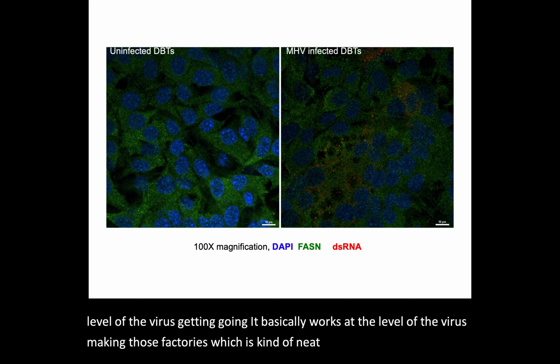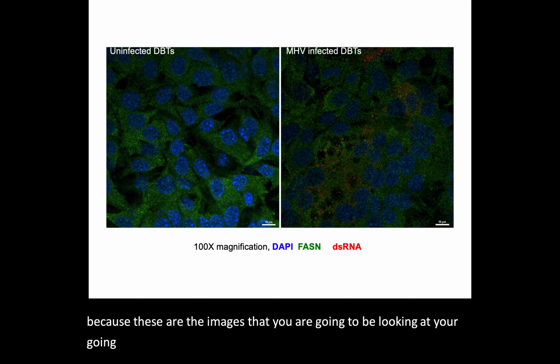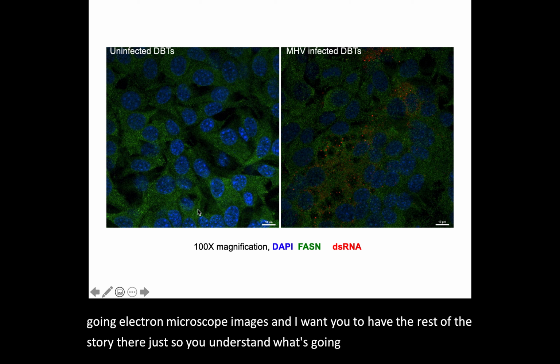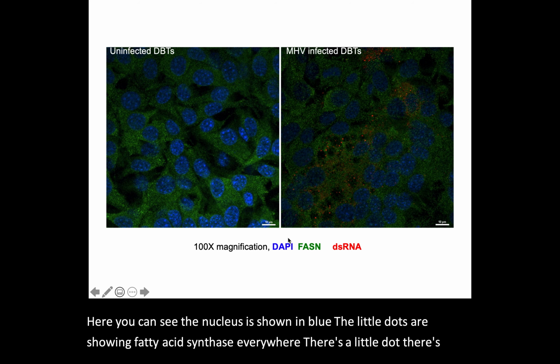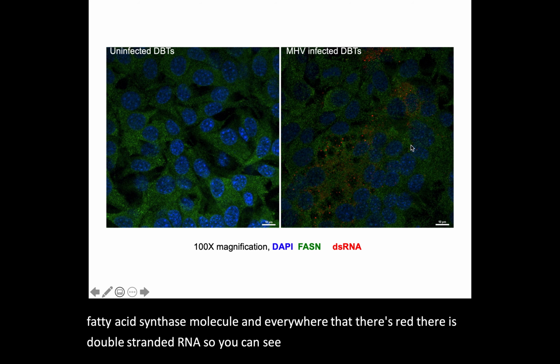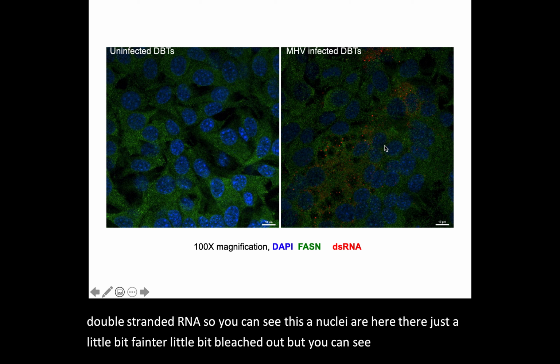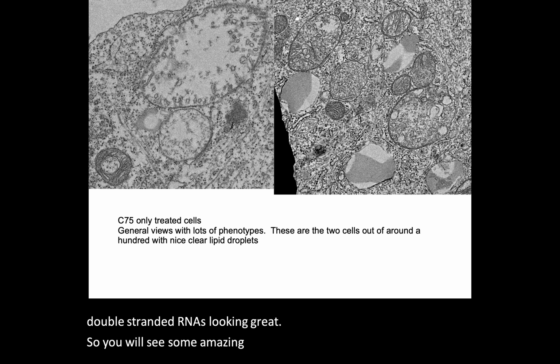So I'm telling you all of this because these are the images that you are going to be looking at. You're going to be looking at electron microscope images. And I want you to have the rest of the story there, just so you understand what's going on. Here you can see the nucleus is shown in blue. The little dots are showing fatty acid synthase. Everywhere there's a little dot, there's a fatty acid synthase molecule. And everywhere that there's red, there is double-stranded RNA. So you can see the nuclei are here. They're just a little bit fainter. They're a little bit bleached out, but you can see the nice little double-stranded RNAs. Looking great.